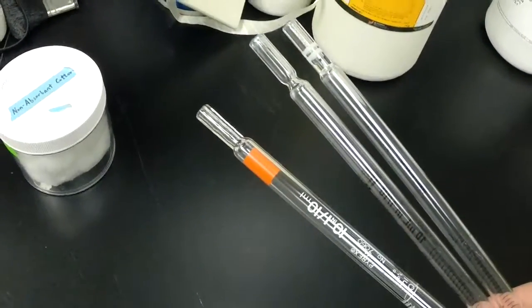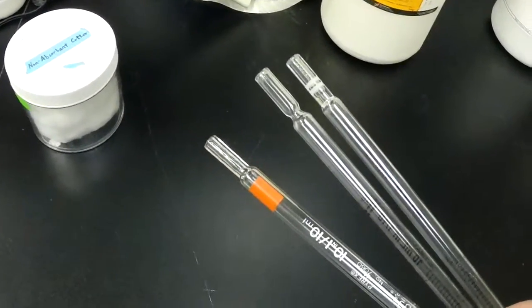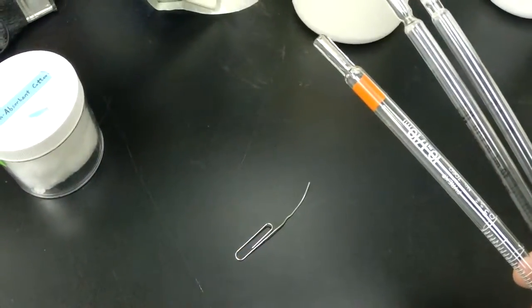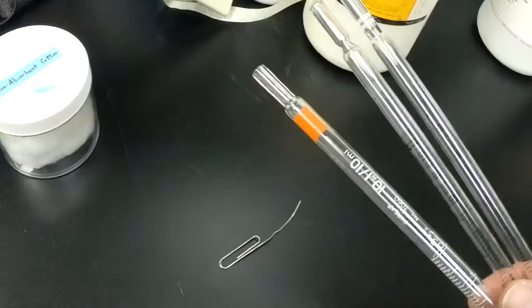The process of actually carrying out the stuffing requires an important tool. That important tool is nothing more than a paper clip.